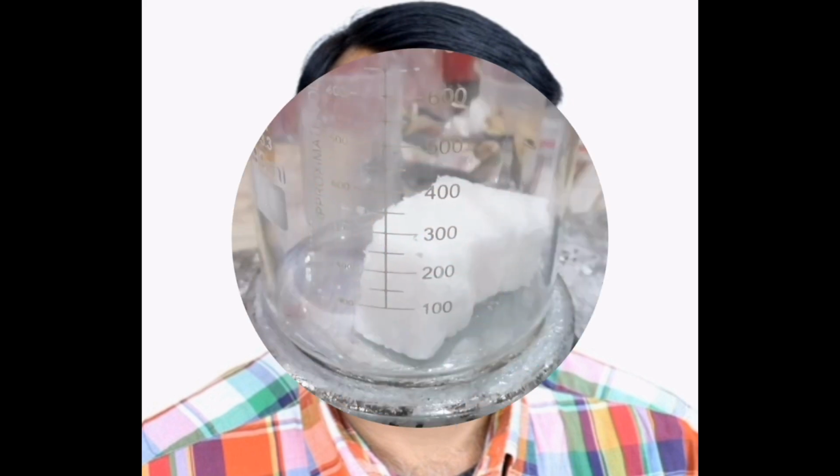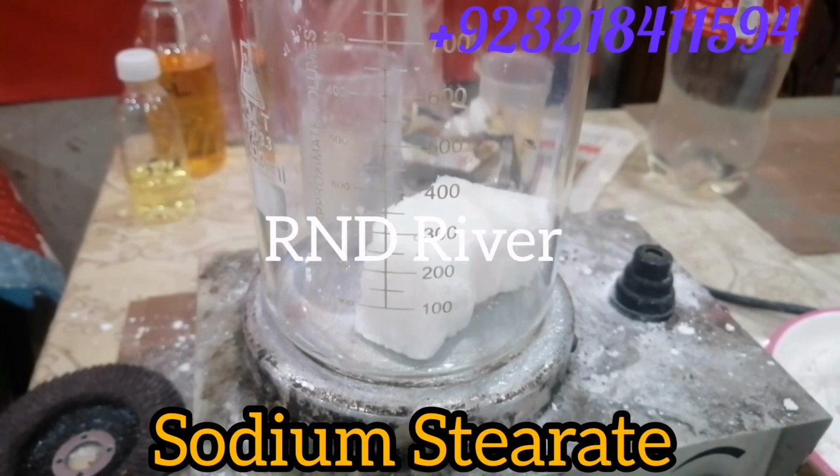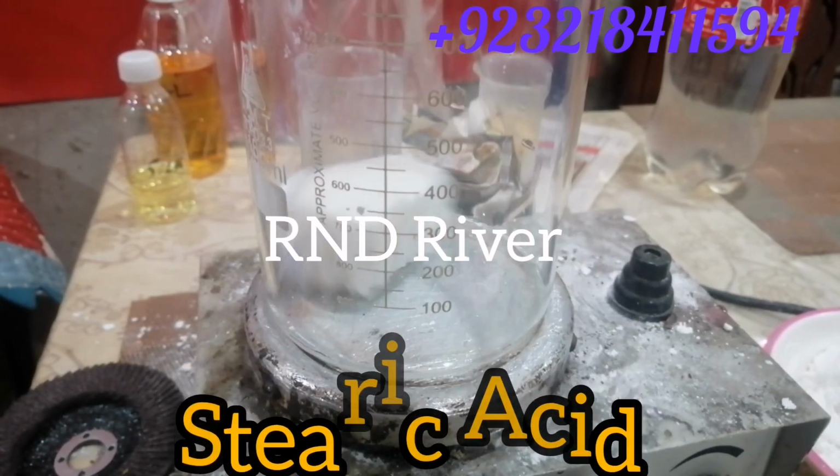In this video, I will give you the complete and detailed formulation of calcium stearate. Now, let's come to the process. For calcium stearate, first of all, we have to make sodium stearate. This is how the sodium stearate is formulated. First of all, we have to take stearic acid and raise the temperature.